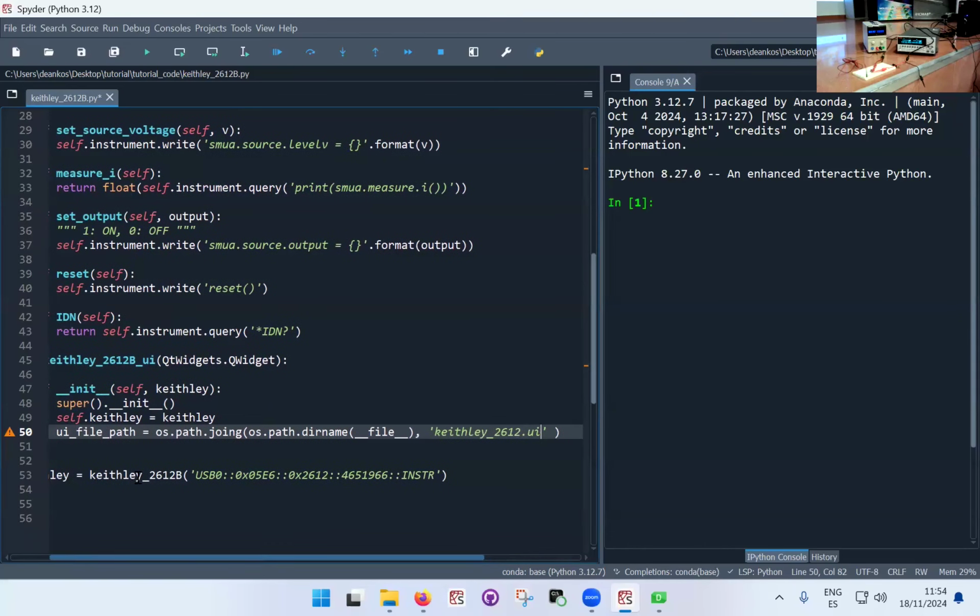So I'm giving the path of the user interface file, which is what we created with the Qt Designer, using this package and join without the G. Join the path of the directory of where I'm currently executing, and this is kind of how I generally use it. I put the user interface file in the same directory of the instrument that I'm programming. So it looks like that.